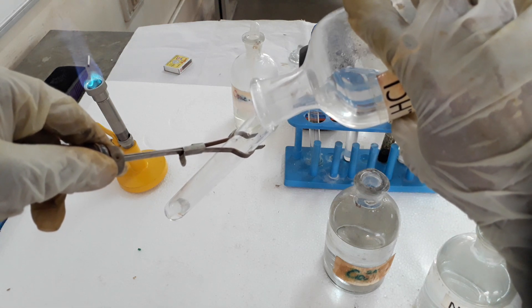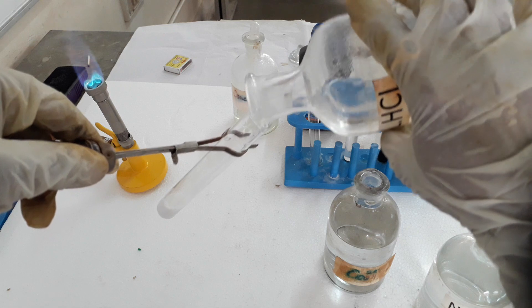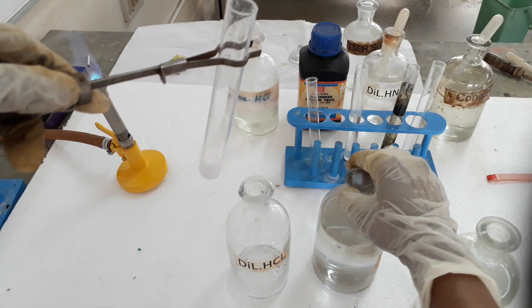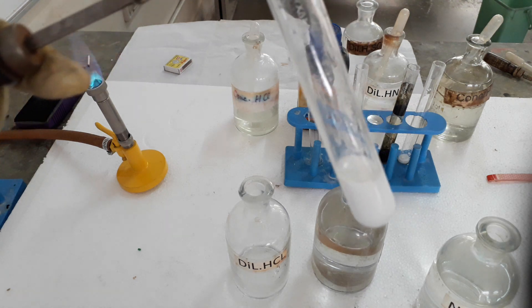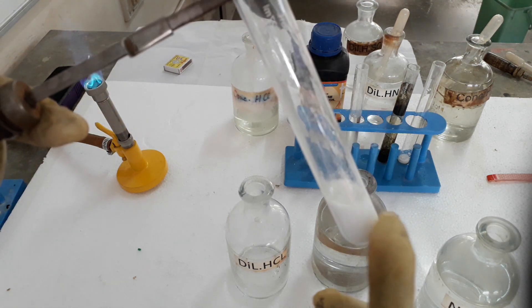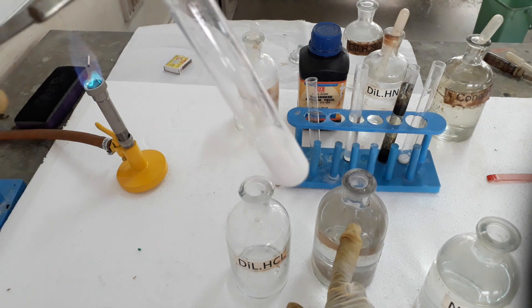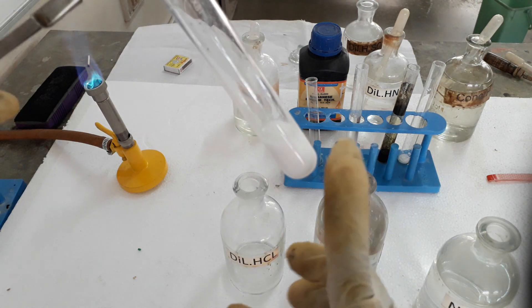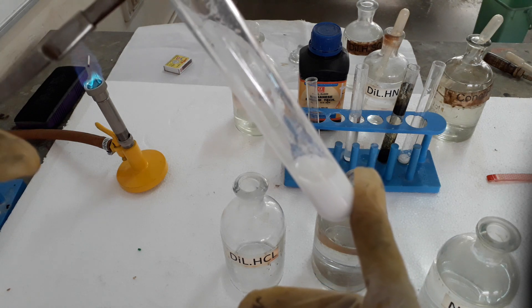When we add dilute hydrochloric acid, we get a curdy white precipitate. See here — we have got the curdy white precipitate. This is AgCl. So silver nitrate reacts with dilute hydrochloric acid giving us AgCl, that is a curdy white precipitate.